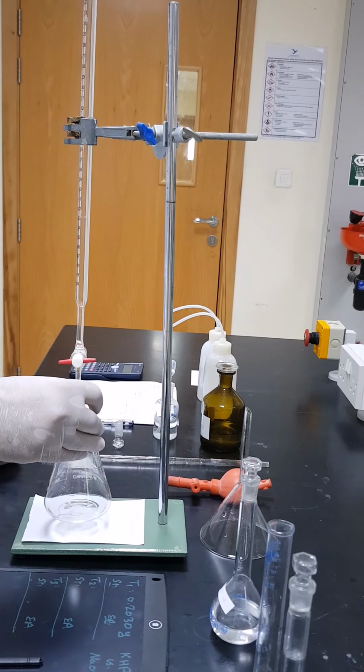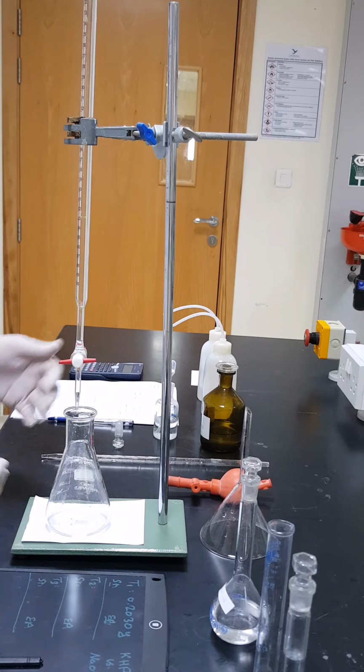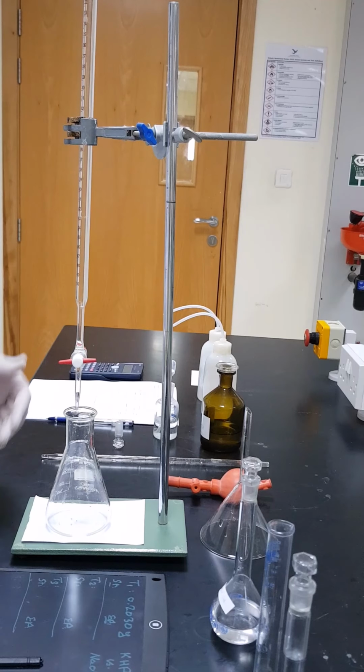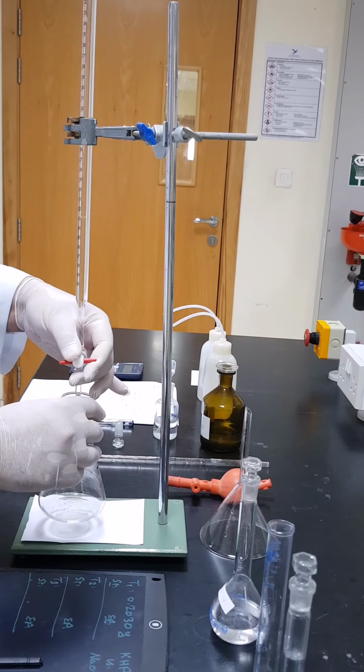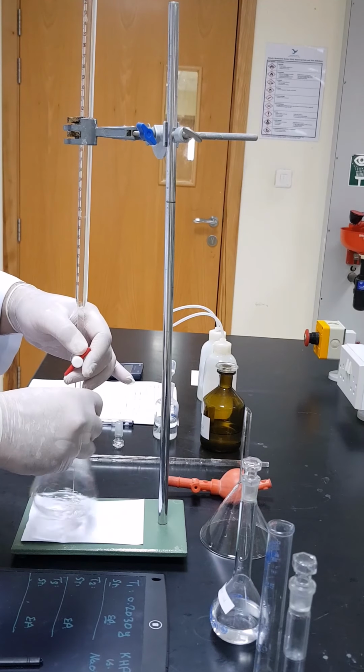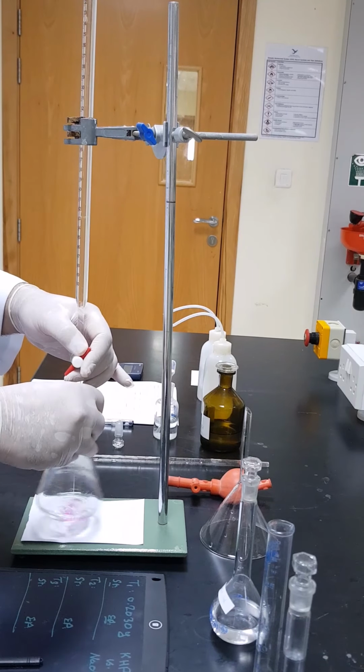Now we are going to proceed with titration. As I told you before, we have 2 scenarios. We can do quick titration, and we already have done that, and we found the approximate volume, which is around 10. So now we are going to proceed with the slow titration by going rapidly to 7 milliliters. Then I will start slowing down.